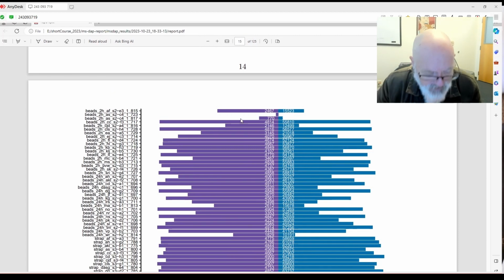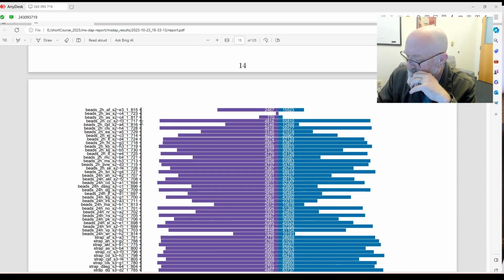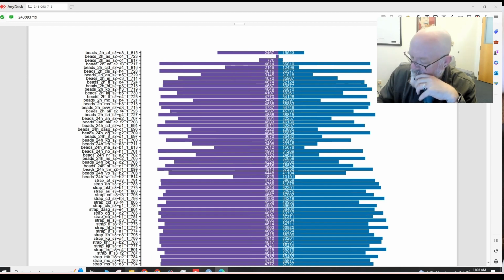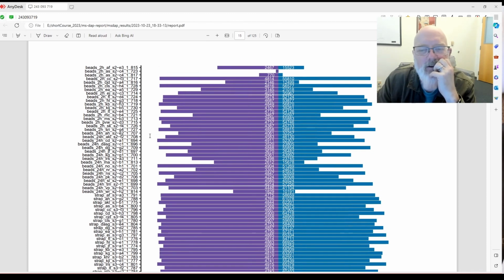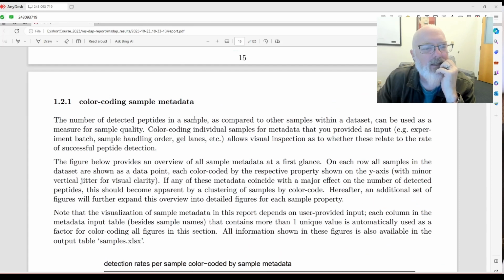for example, 723. So I'm going to write that down. So we may want to exclude 723 when we redo the analysis, and maybe 817 if it didn't exclude it already. And if we do this one, is this 814? Okay, so maybe we want to exclude 813. We'll see. Okay, so that looks pretty nice. You can definitely see there's more consistency here with the S-traps and the urea. Okay, so what else do we got?